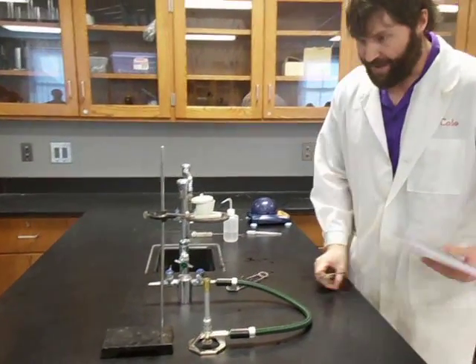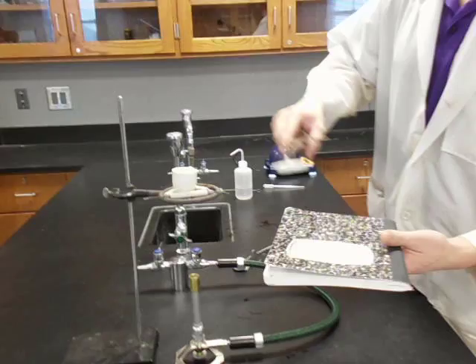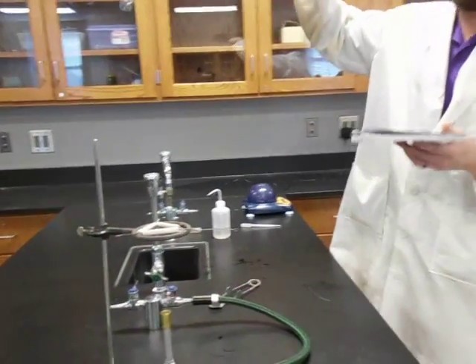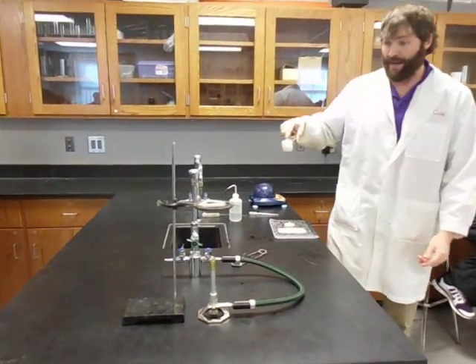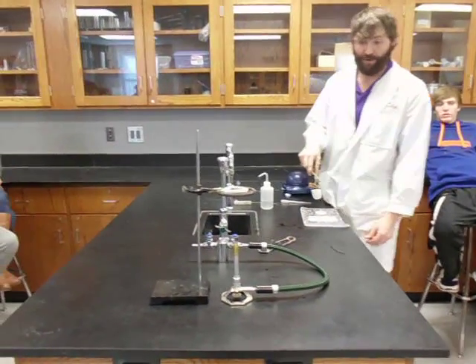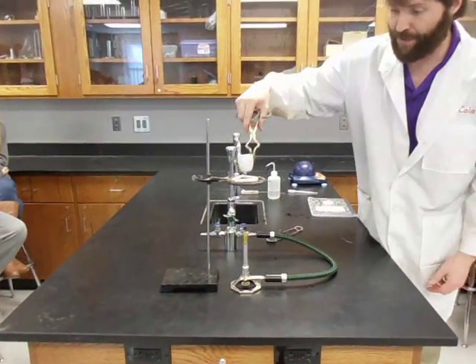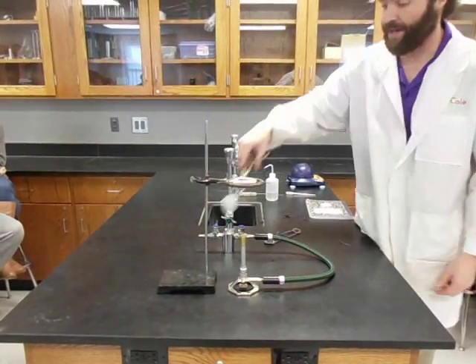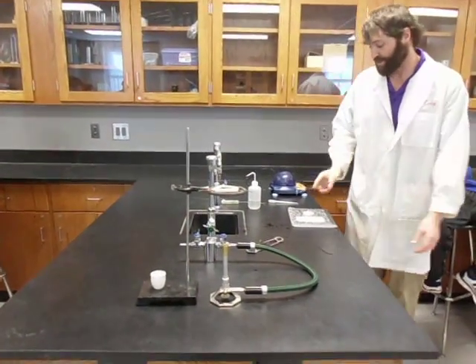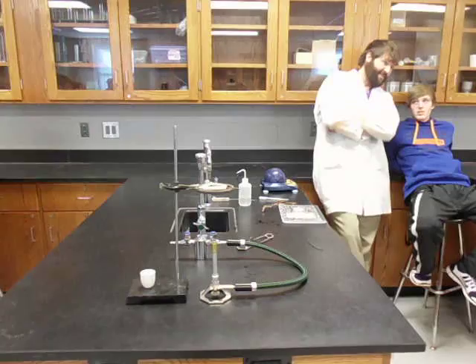After you've done this, I need this to cool. Do not try and weigh it hot. Don't set it down on top of a lab book right now — it will burn a hole in your lab book. If you leave it on the triangle, it takes longer to cool down. Don't blow on it either because you might get spit on it and that's going to change the weight.